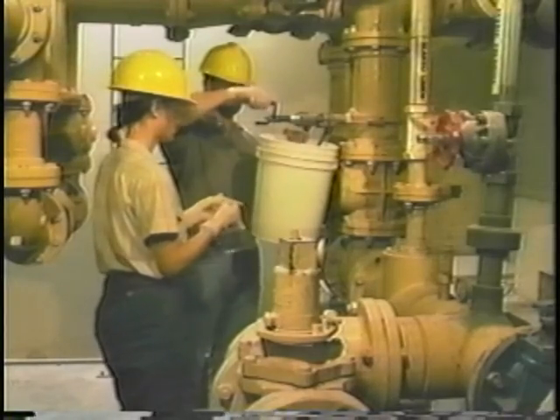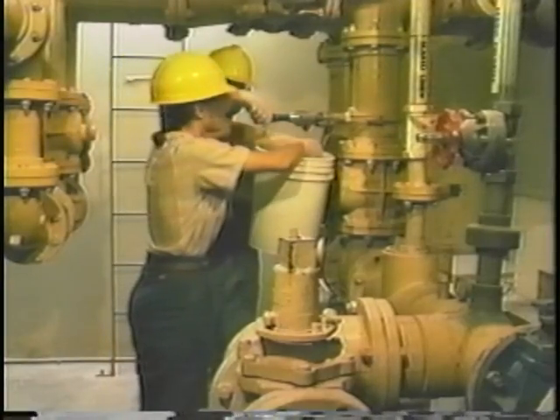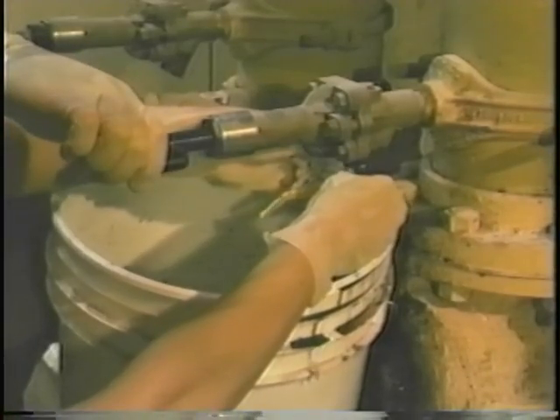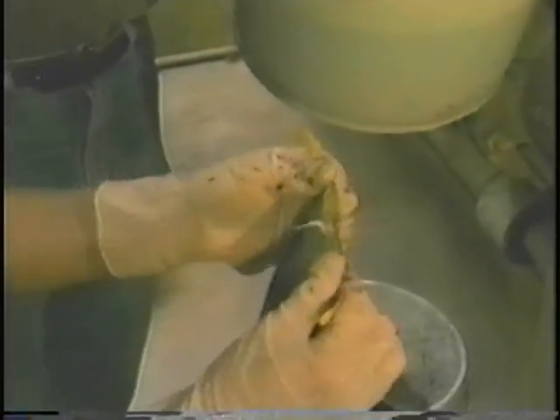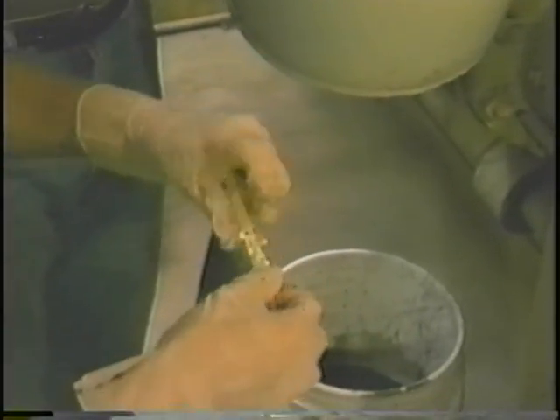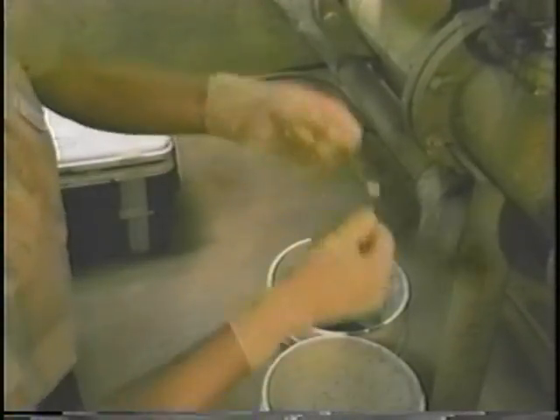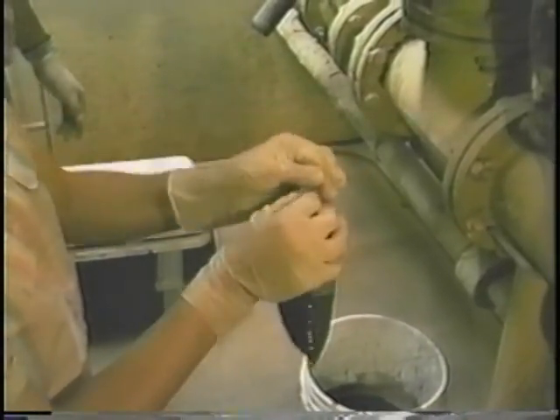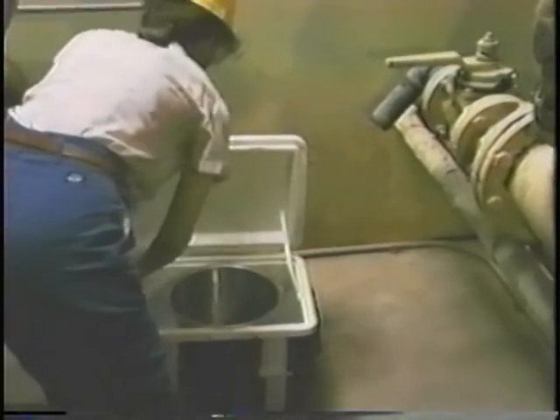The first sample collected is for pathogens using a sterile sample bag. To collect a single grab sample, place the sample container directly under the sludge stream. Nothing but the sample itself should touch the inside of the bag to prevent contamination. Leave a half-inch of headspace at the top of the container to provide room for expansion in the event of gas production due to biological activity, unless you are collecting a sample for volatile organic pollutants. Liquid sludge, especially anaerobically digested sludge, is particularly susceptible to gas production.